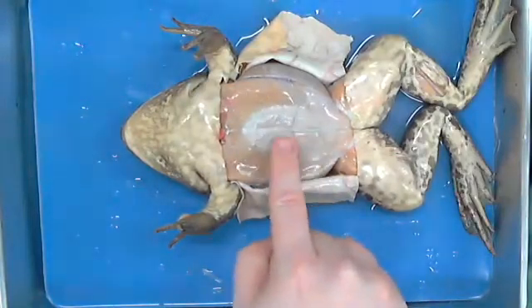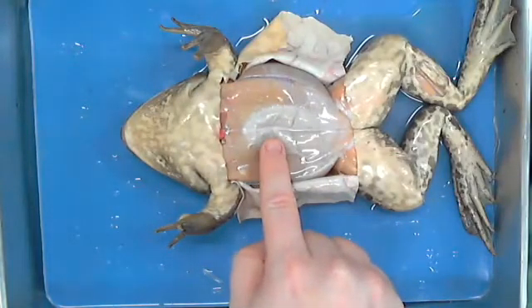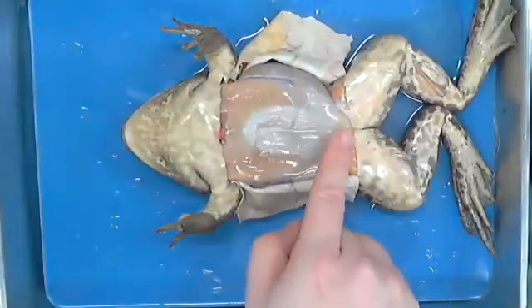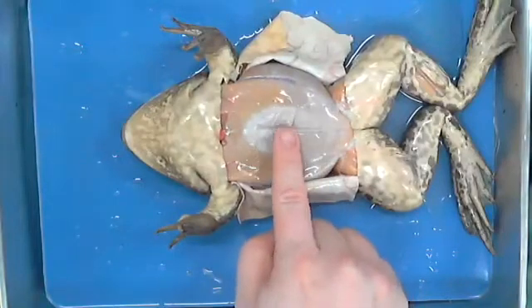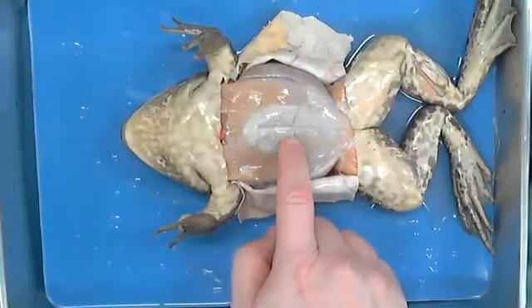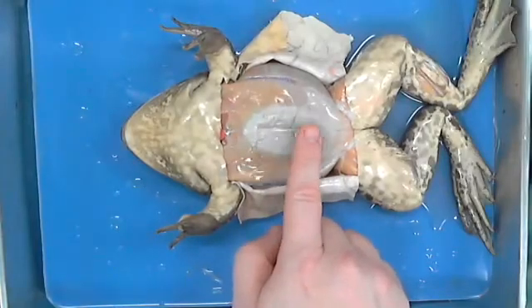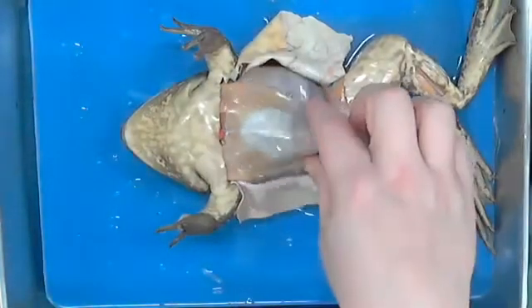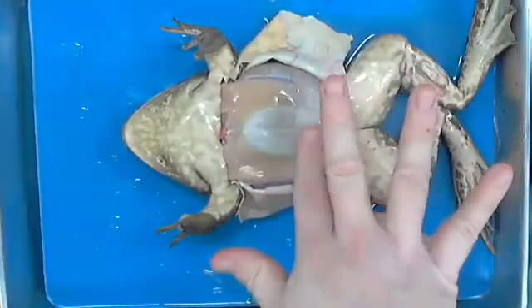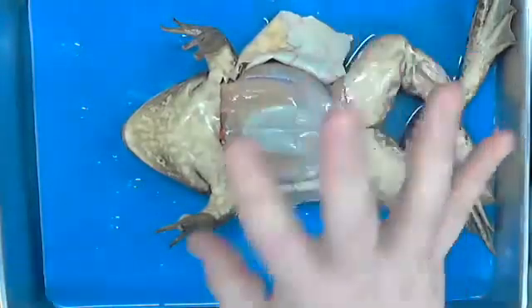I don't know. Huh? The membrane. What do we have in our stomach area right here on the outside? A lining. Nope. I've got eight of them because I'm so awesome, because I'm ripped and work out all the time. Abs. These are his musculature, right, that allows him to basically bend and move in the stomach, etc. I mean, all that region.